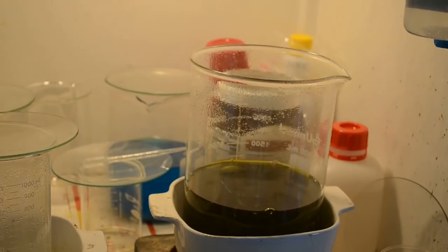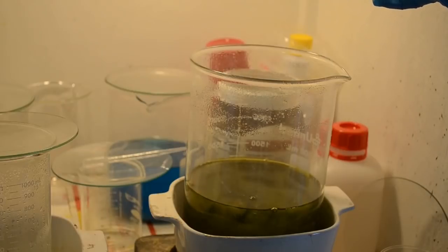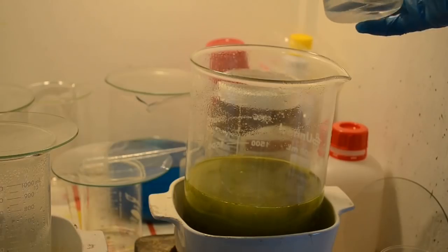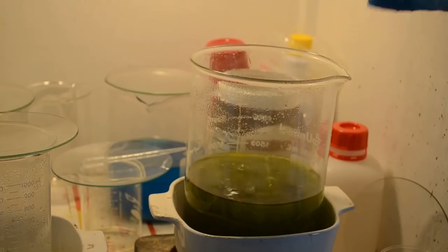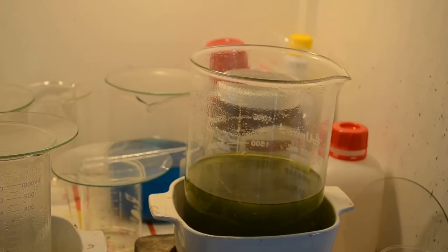Now there should be some free nitric in there because I've added some. So let's see what happens. Oh yeah, got a reaction that time. Okay, but I'd already added some sulfuric acid to it just in case there was no free nitric acid. So hopefully, if I let this cool down and I dilute it, any silver in solution should hopefully drop out as both silver chloride and silver sulfate. And then we should get a fairly nice clean gold drop the second time around here.